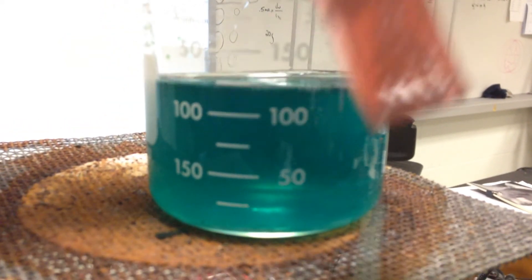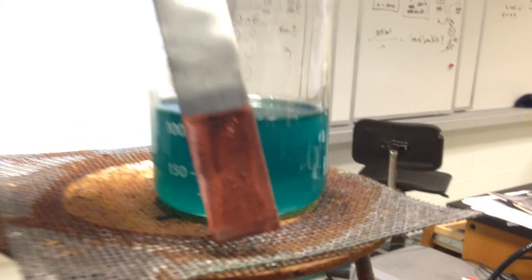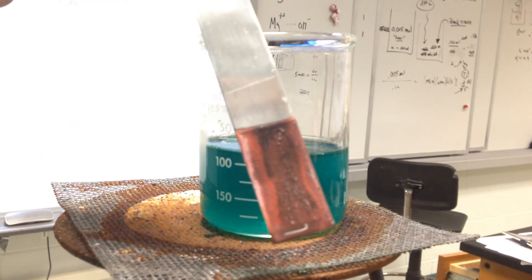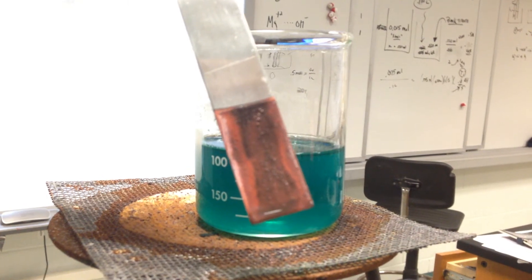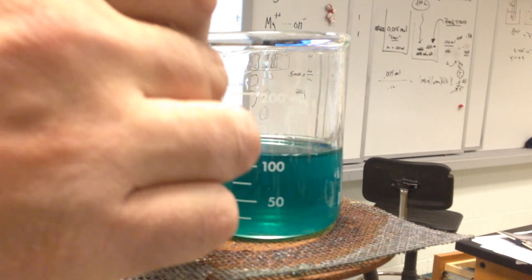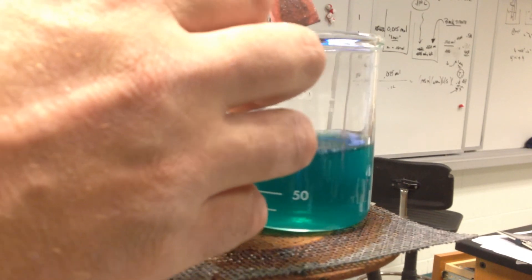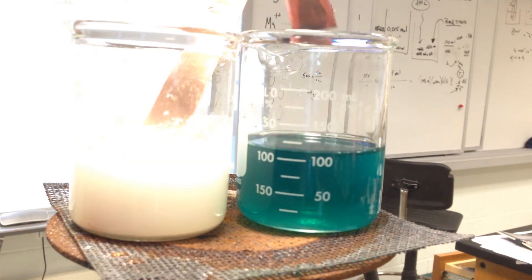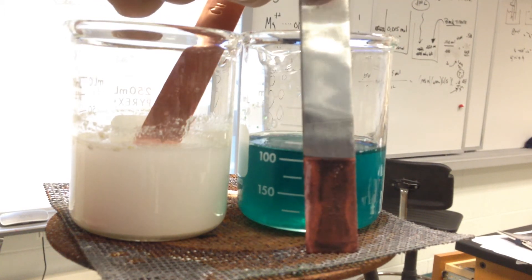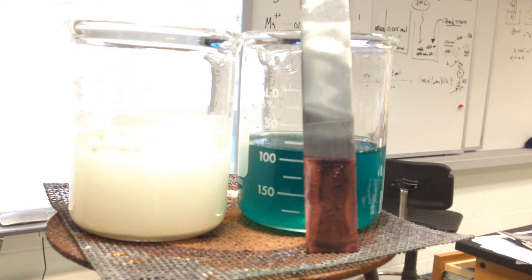So there's your plating, there's your spontaneous redox reaction. In the other beaker, we're not going to have that because of the non-spontaneous combination of a poor oxidizer and poor reducer.